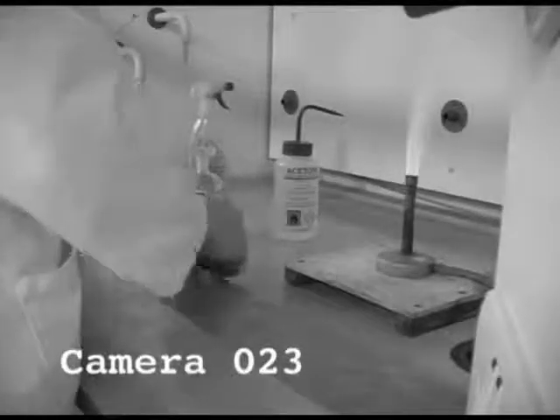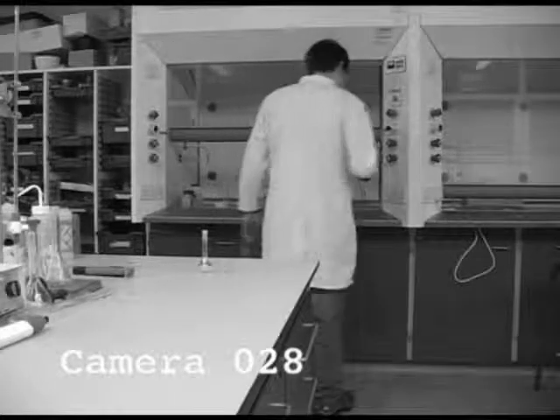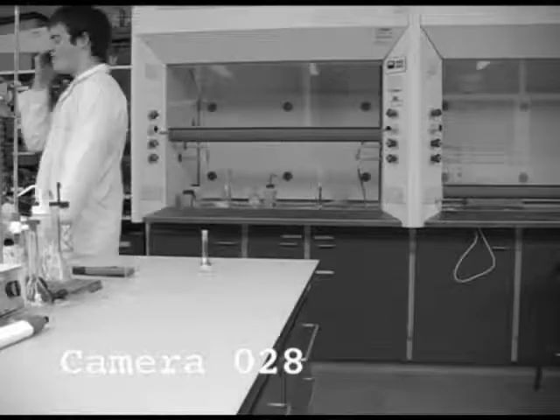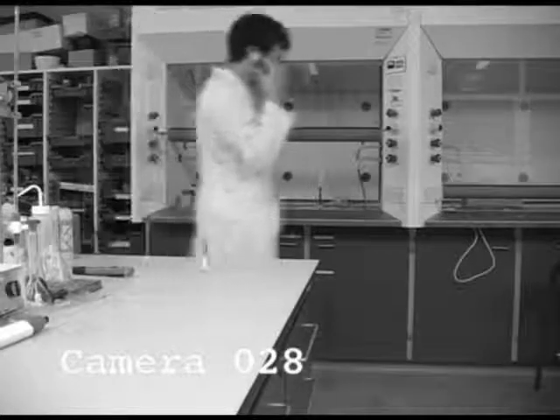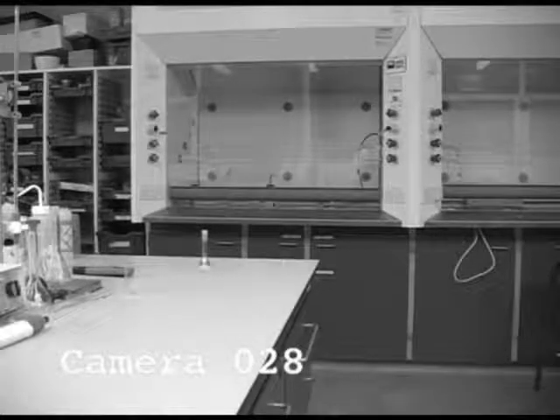Now, this is the next bit. If we just look over here, you have interrupted the experiment to answer your phone. Well, that's fine, isn't it? No. Well, why not? Because if you are on your phone during a practical, you are not giving the practical your full attention. What happens if it's an emergency? If it's an emergency, a message will be brought to the lab. Okay.